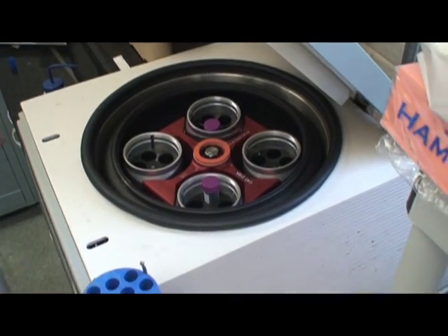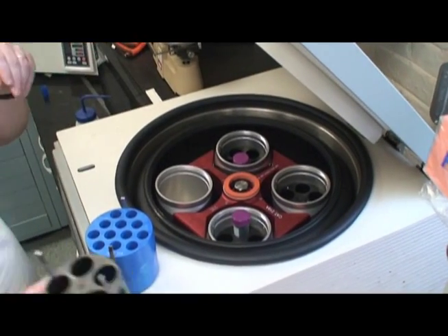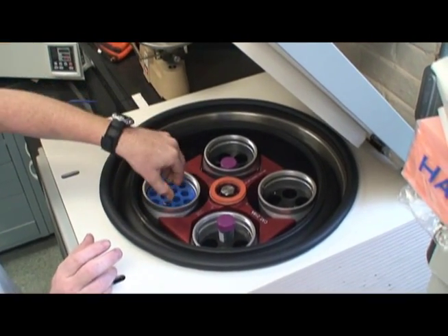This centrifuge has the ability to spin tubes of different sizes at the same time. However, different test tube holders must be inserted into the buckets.